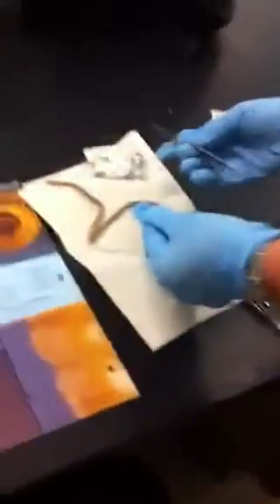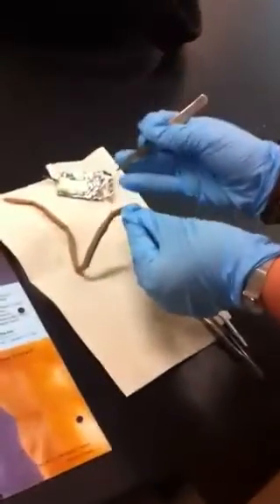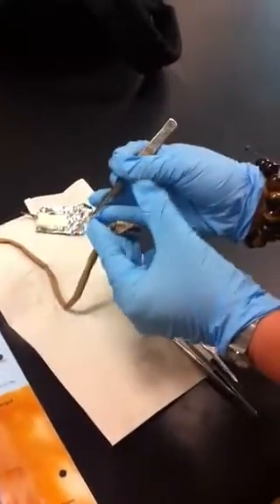Okay. We should have ripped it open like that. A what? We were all scared to rip it apart. No, they don't rip. It's all good.